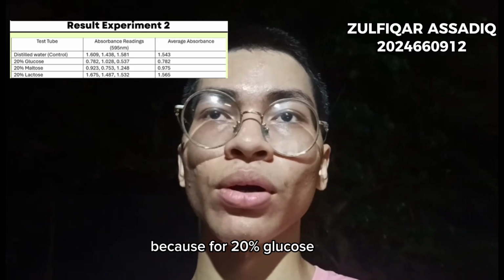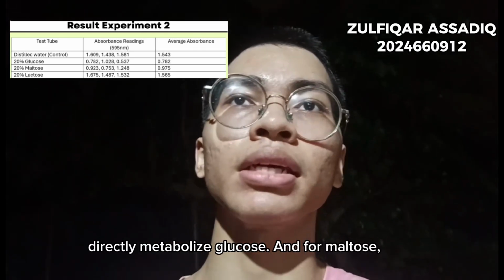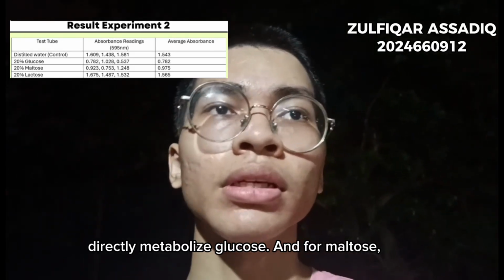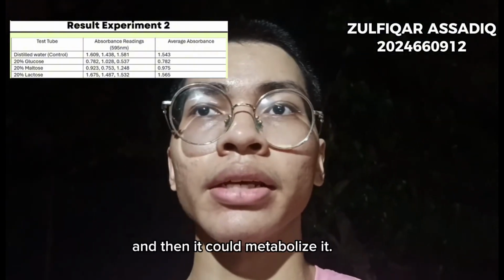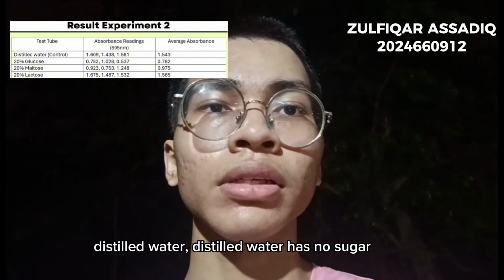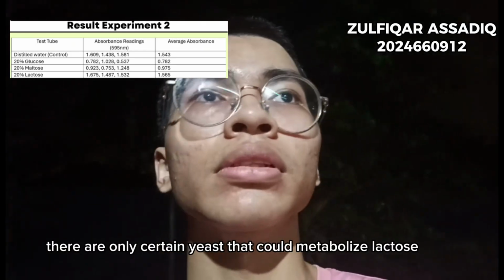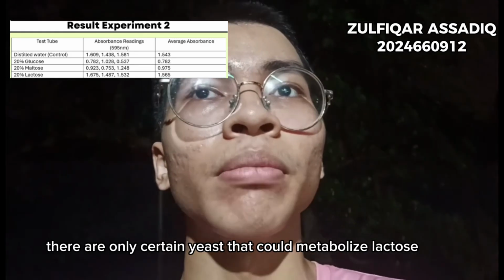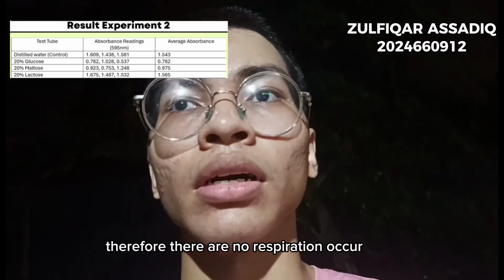Because 20% glucose has the lowest absorbance, since yeast could directly metabolize glucose, and for maltose yeast needs to break down maltose into glucose and then it could metabolize it, and then followed by distilled water. Distilled water has no sugar, so there is no respiration occurring. And for lactose, only certain yeast could metabolize lactose, therefore there is no respiration occurring.